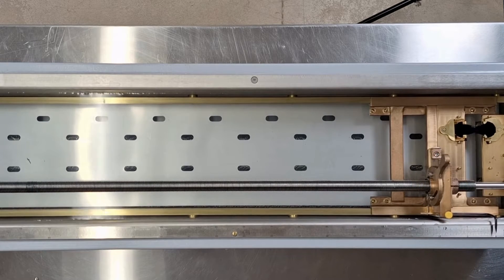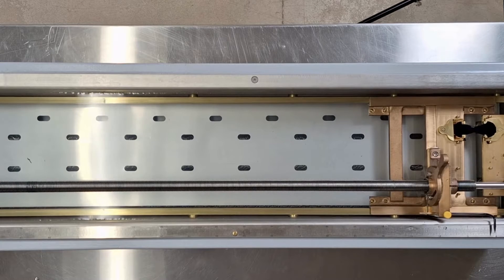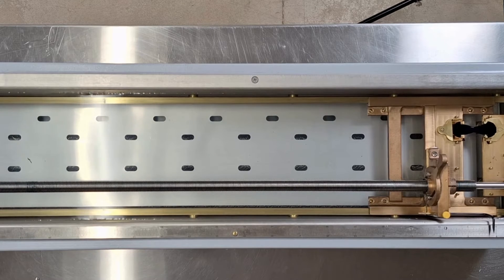Pull the two clips apart at a constant speed as specified until the sample breaks or reaches the length limits of the machine.